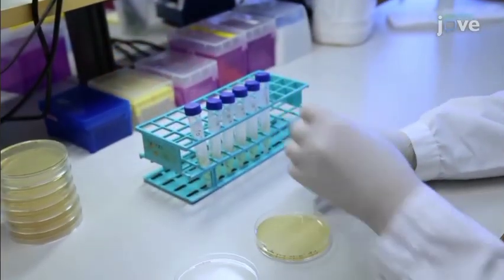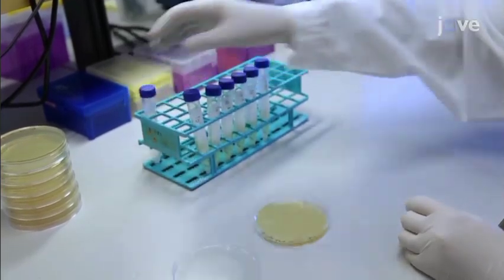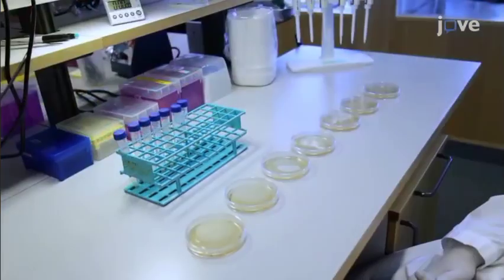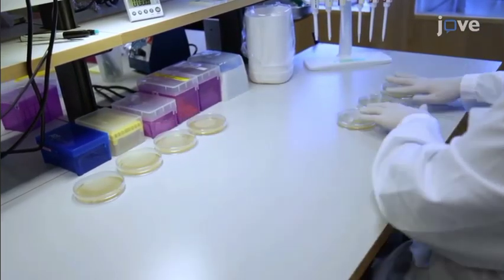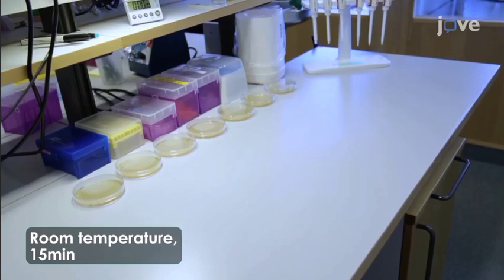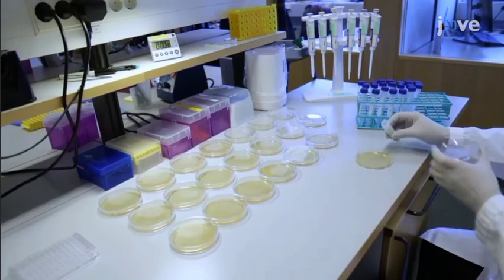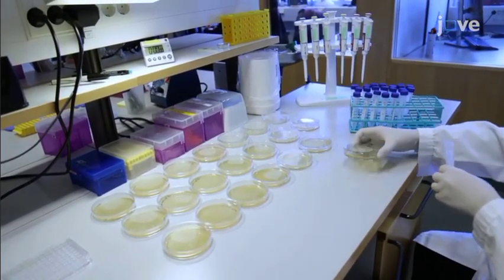Gently transfer 5 milliliters of bacteriophage mix onto the respective Petri plate. Evenly spread the mix throughout the whole surface by gently swirling the Petri plate. Once all of the Petri plates are layered with the mix, allow solidification of the top layer by incubating at room temperature for 15 minutes. After completion of these steps, repeat the process for the second and then the third sets of the Petri dishes using the remaining 2 sets of phage dilutions.